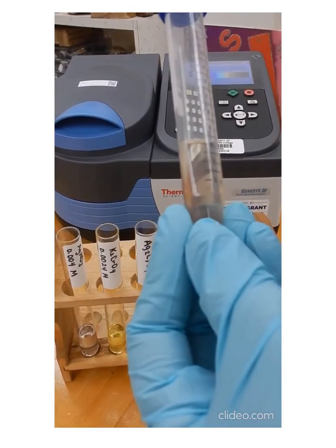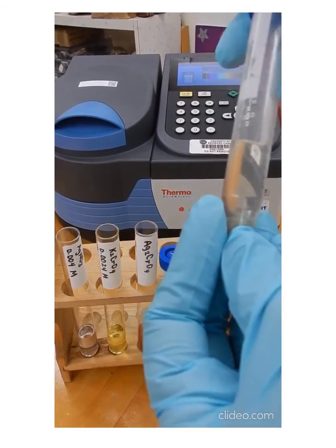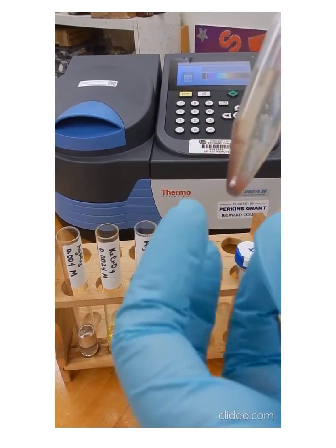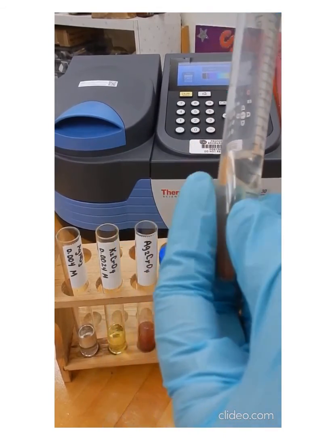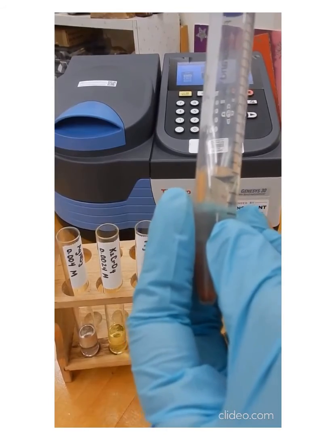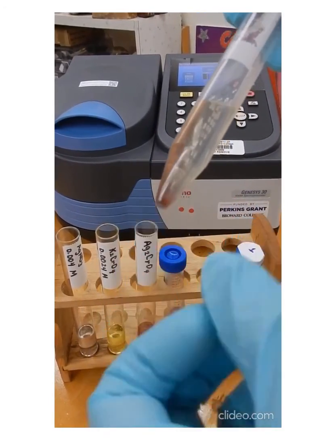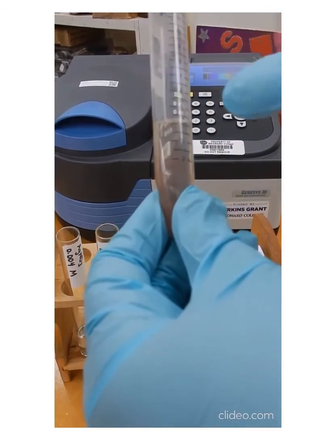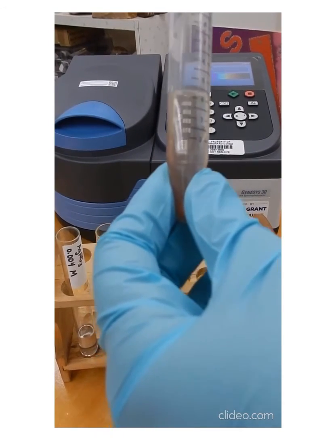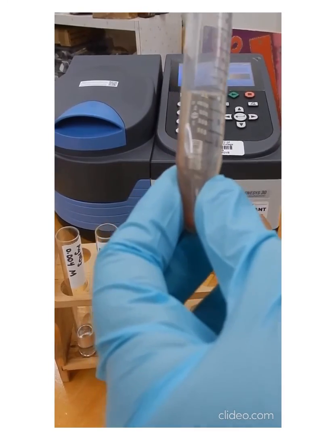What we're trying to accomplish with this step is to remove any chromate ions remaining in that solution, because when we're measuring absorbance for this sample, we want the absorbance from the chromate ion that is coming from the dissolution of the solid that you have here. If there are some chromate ions in your solution that are just from your potassium chromate solution, we want to make sure that those ions are not present, affecting our measurement.